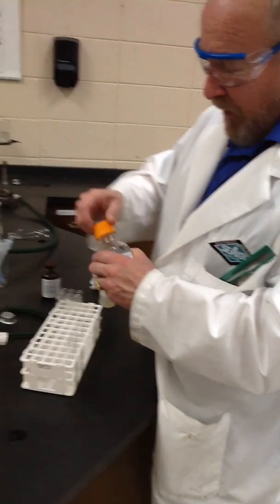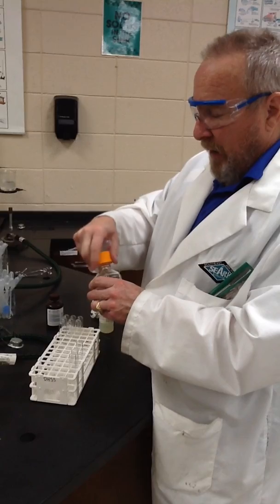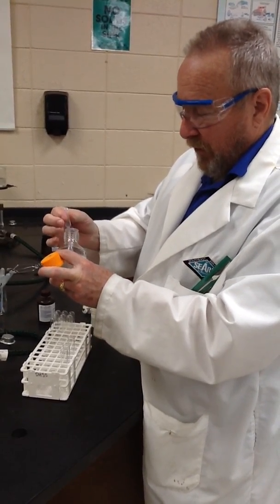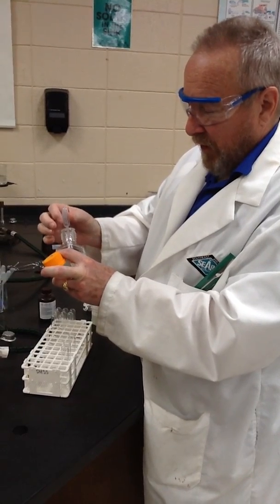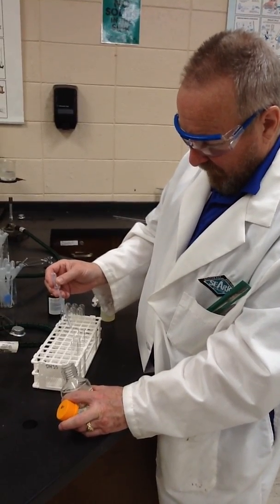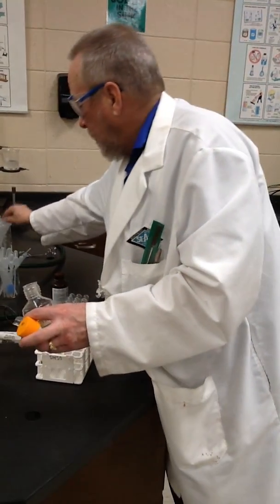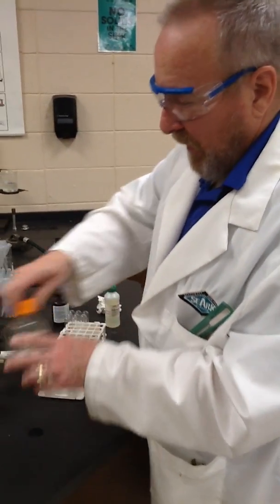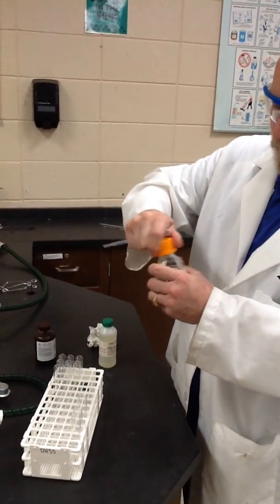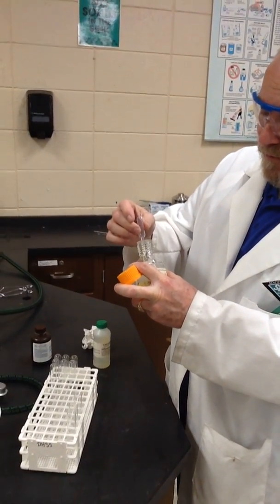Never use a pipette twice. Don't cross-contaminate the solutions. In lab, these bottles would actually be test tubes where I took a little bit out so we don't ruin our stock solutions. The next one is sodium bromide. And the last one is sodium iodide. You can see it has a slight yellow tint to it. It's not going to be yellow when we do the reaction.